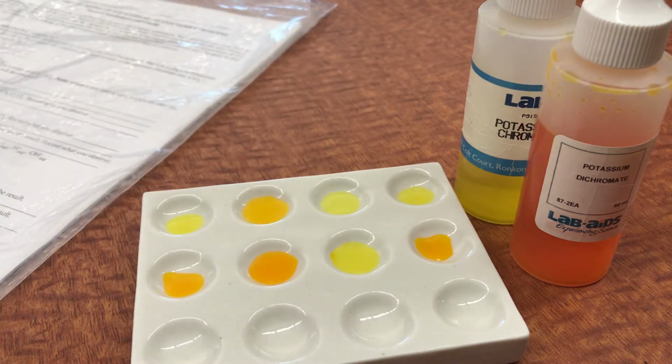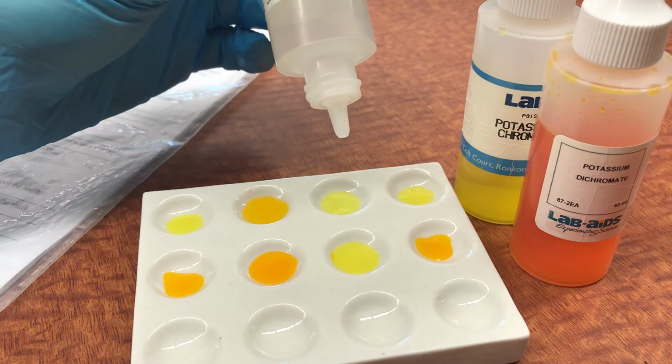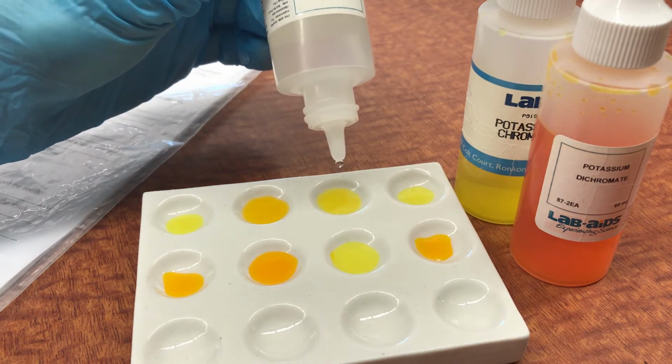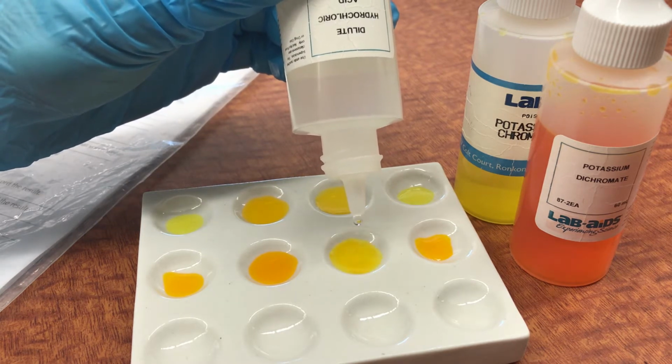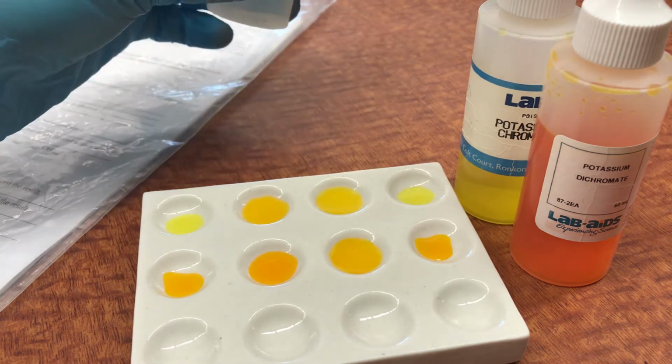And we could actually bring these solutions back just by switching the chemicals. So if I wanted, I can add some more hydrochloric acid, but now add it to the one that I just added the OH to, and the chemical will shift back, and I can shift it back again. So here I am forcing this thing to find a new equilibrium.